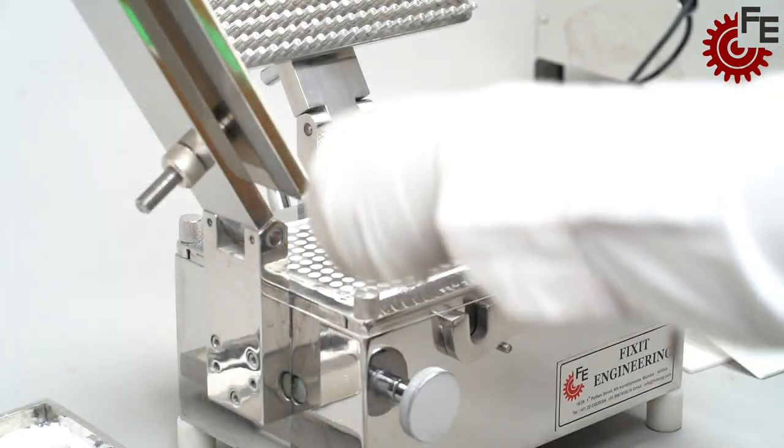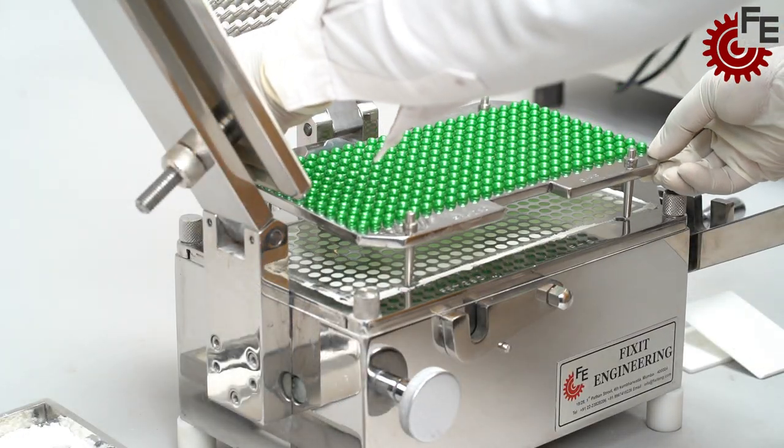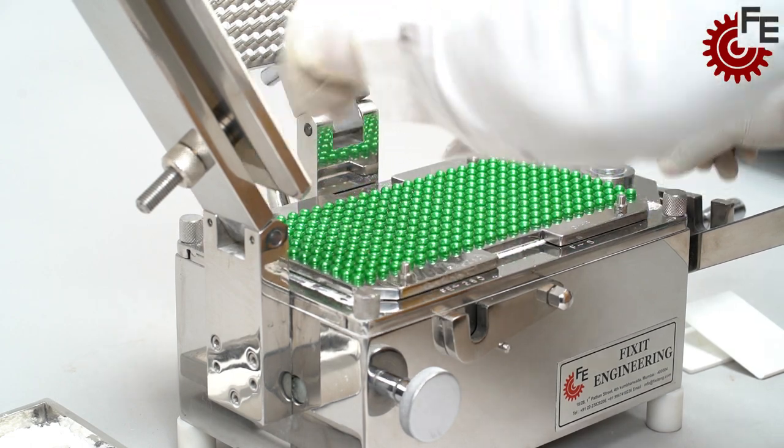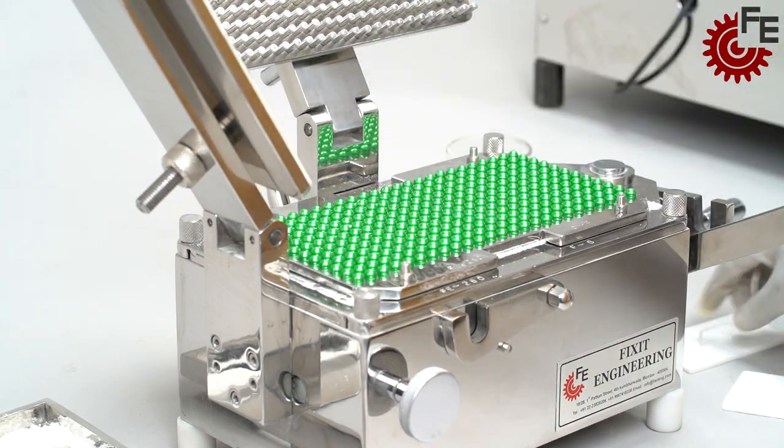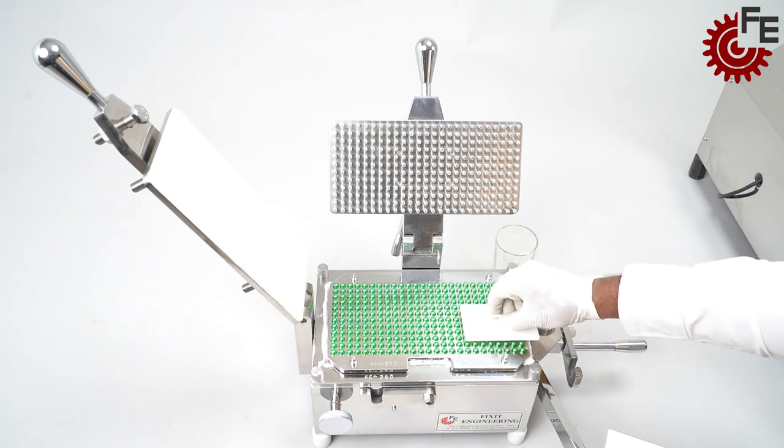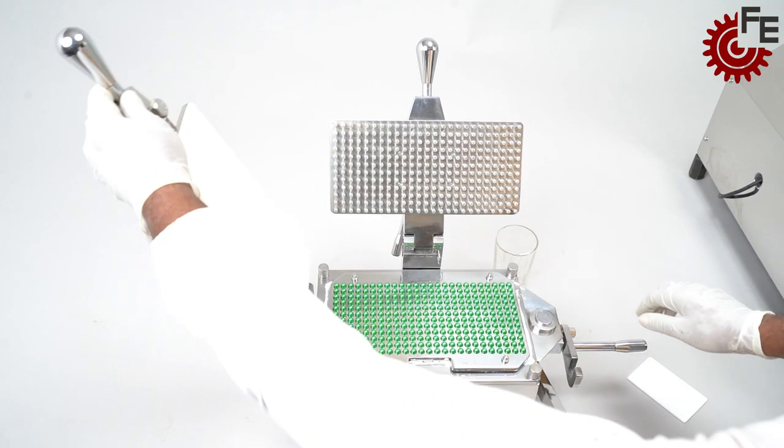Put back the 300 hole capsule tray which contains capsule caps. Close the closing plate.